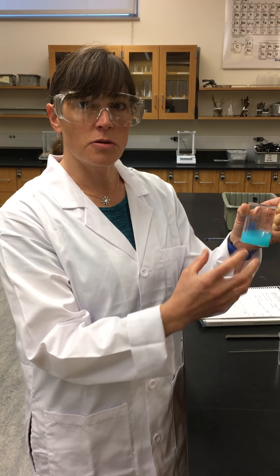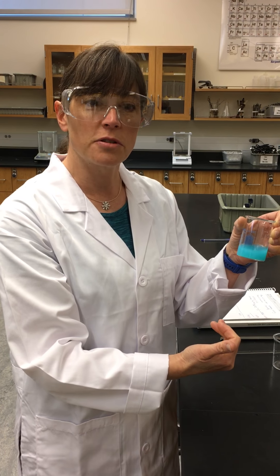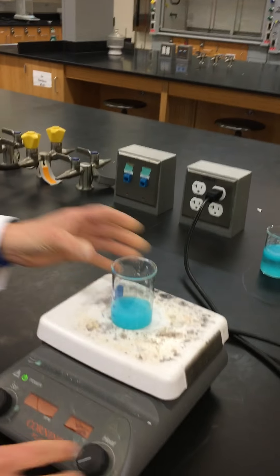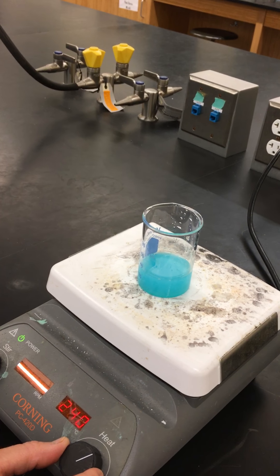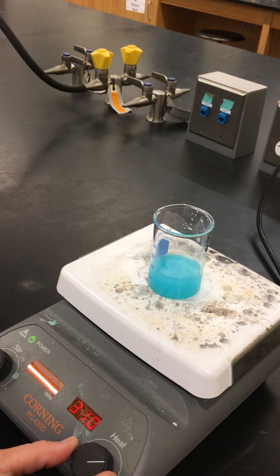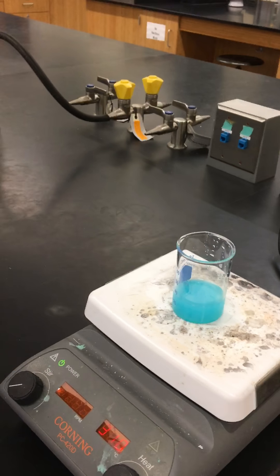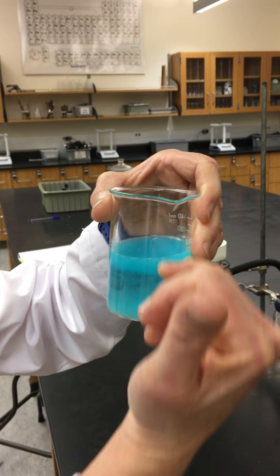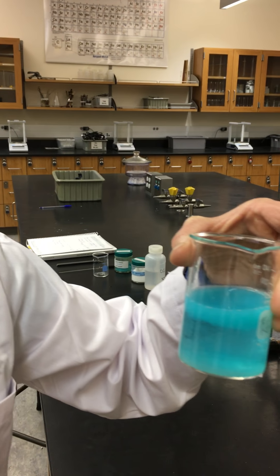Before we do that, these crystals are so small that if we poured them directly into our vacuum filtration, they would go through the filter paper. So our next step is to heat this up to about 300 degrees. The purpose of this is to make the crystals get larger, so that when we filter it, it's not going to go through the filter paper. We have now heated the sample, and as you can see, we can see the separation and these larger crystals on top. Now it's ready for vacuum filtration.